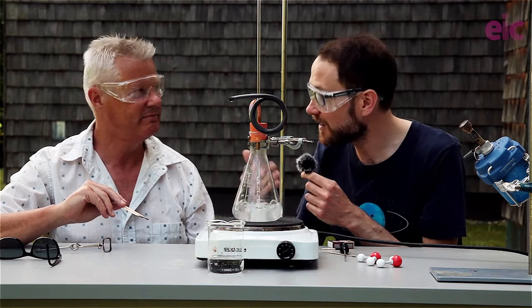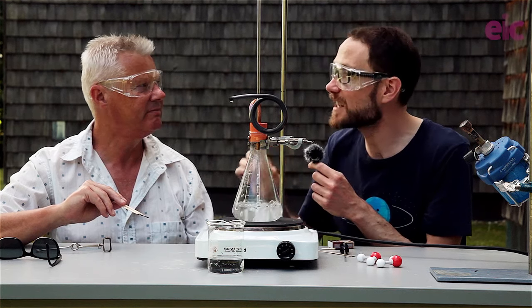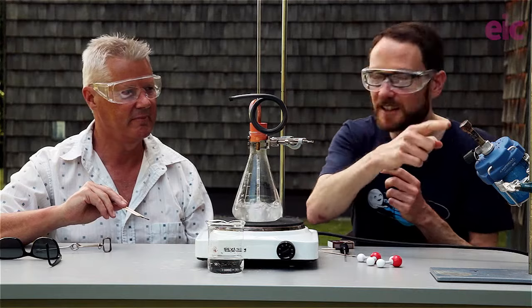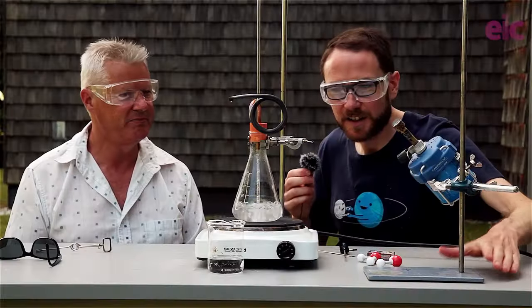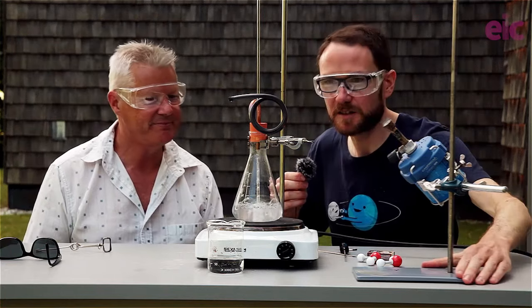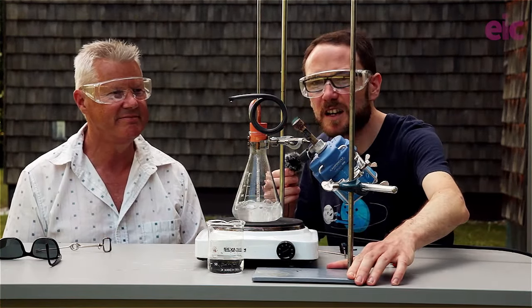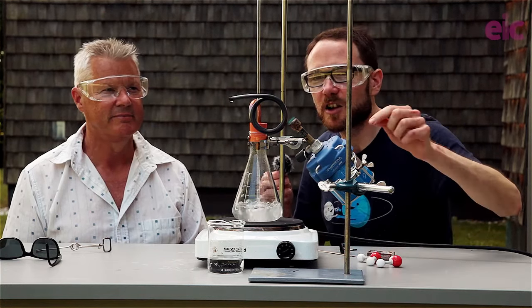But water can, of course, get much higher than 100 degrees Celsius if it has already vaporized. So what we're going to do is give it a second chance for some energy, okay? Okay, so I've lit my blowtorch slash Bunsen. Either of those would be fine for this purpose. And we're bringing this in here and we're just going to heat up the copper tubing.